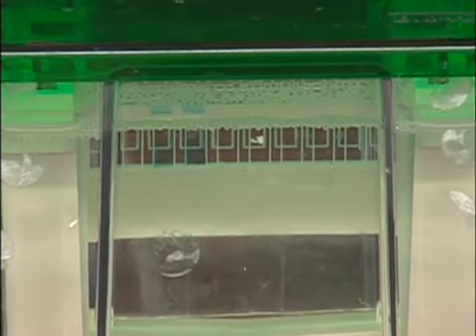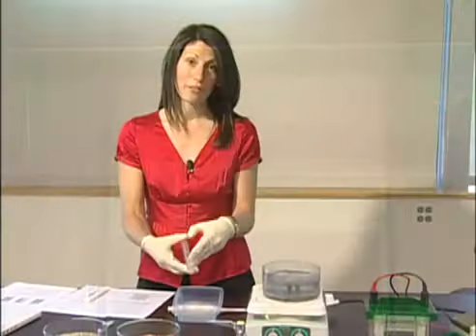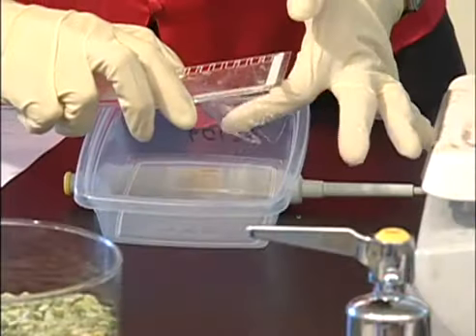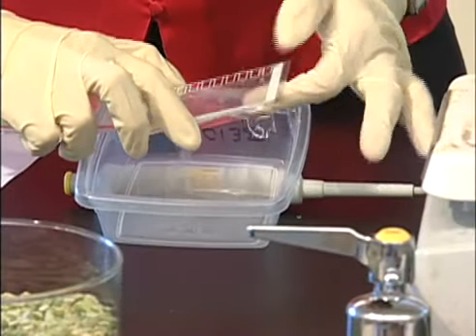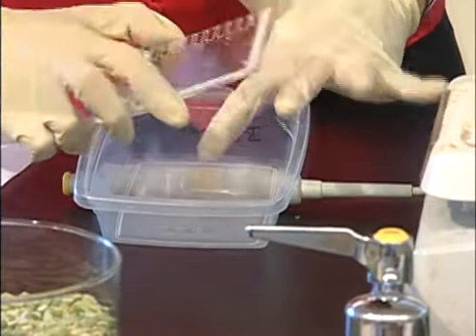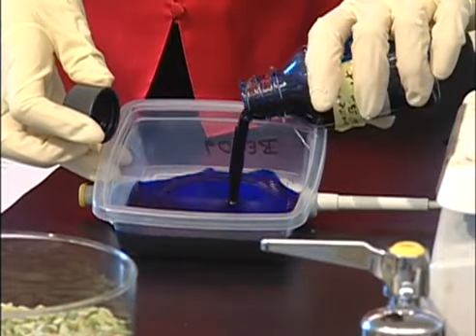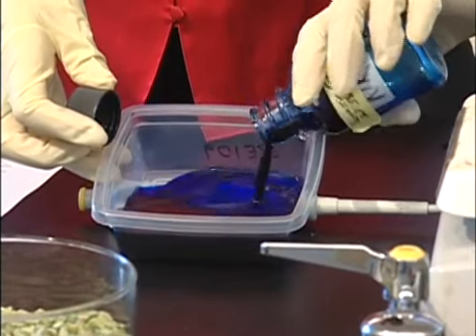In the last step, we remove the gel from the electrophoresis chamber and mix it with a dye called Coomassie stain, which lets us see where the proteins have moved through the gel.